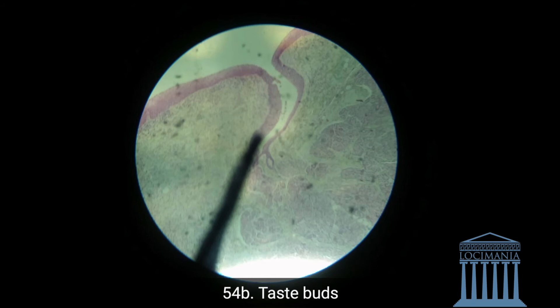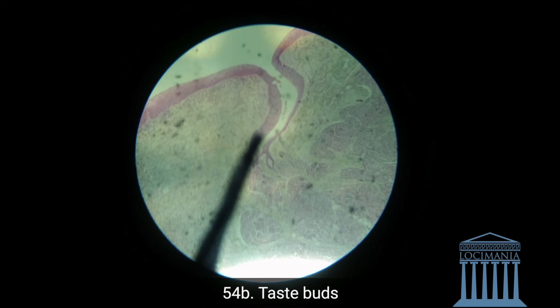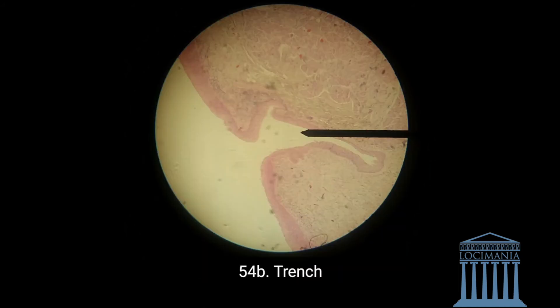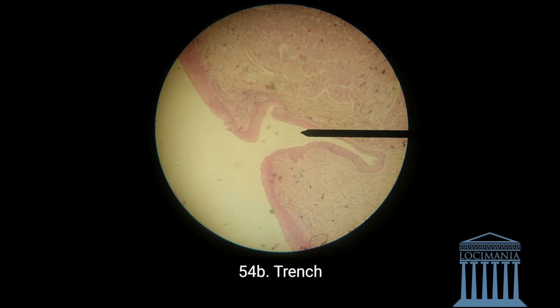The taste buds are always lateral — they are on the wall between the trench. What is the trench? I'm going to show you that right now. Here we have the trench. It's the space between the circumvallate papillae and the other part. This is the trench.